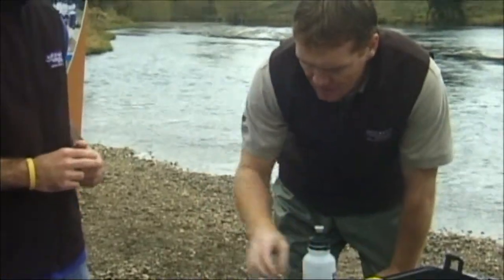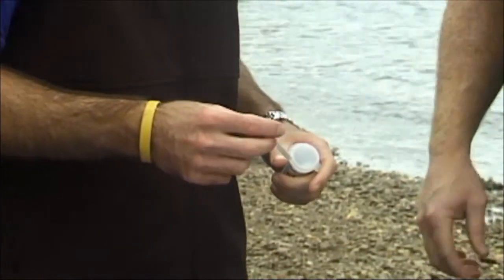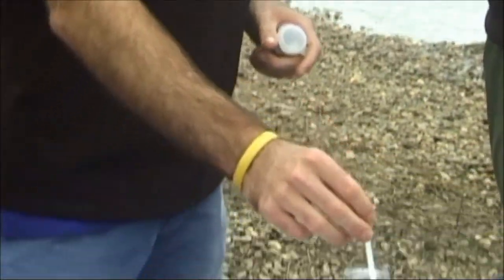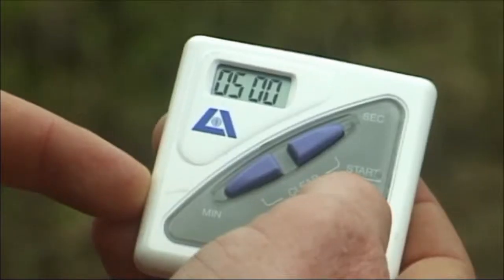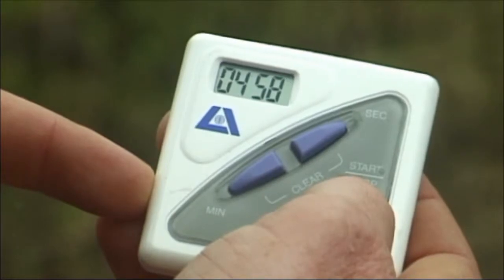Take a pH strip and dip all of the coloured squares into the sample water. Make sure the colours are underwater. Leave the strip in the water for 5 minutes.